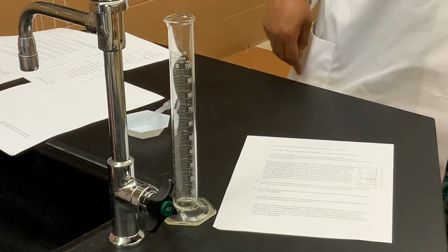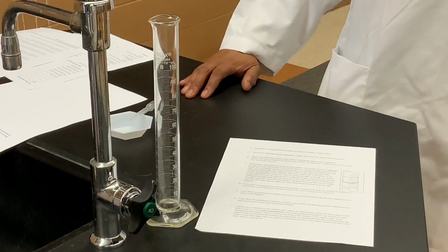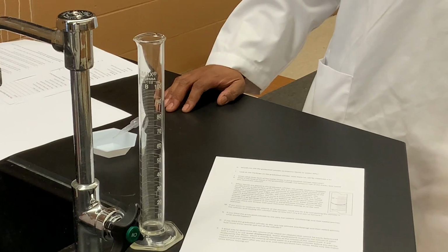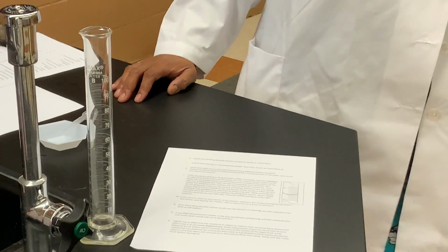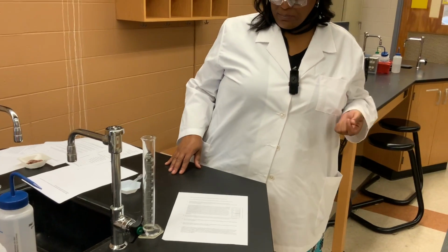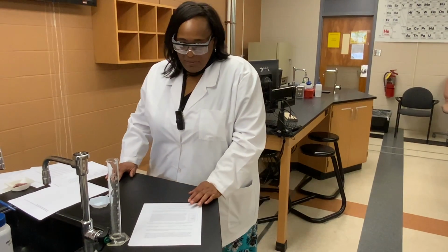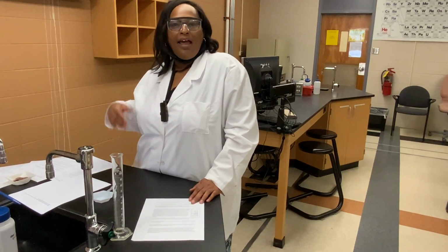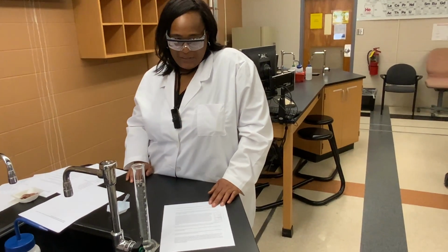Then the last question, P, a good way to determine the volume of solid objects is going to be through a method called the water displacement method. Because solids have their own shape and volume, you can't use the direct graduated cylinder measuring method. You have to use what's called the water displacement method. The water displacement method measures the volume of water displaced by an object. In our case, it's going to be what volume of water gets displaced by the pennies.